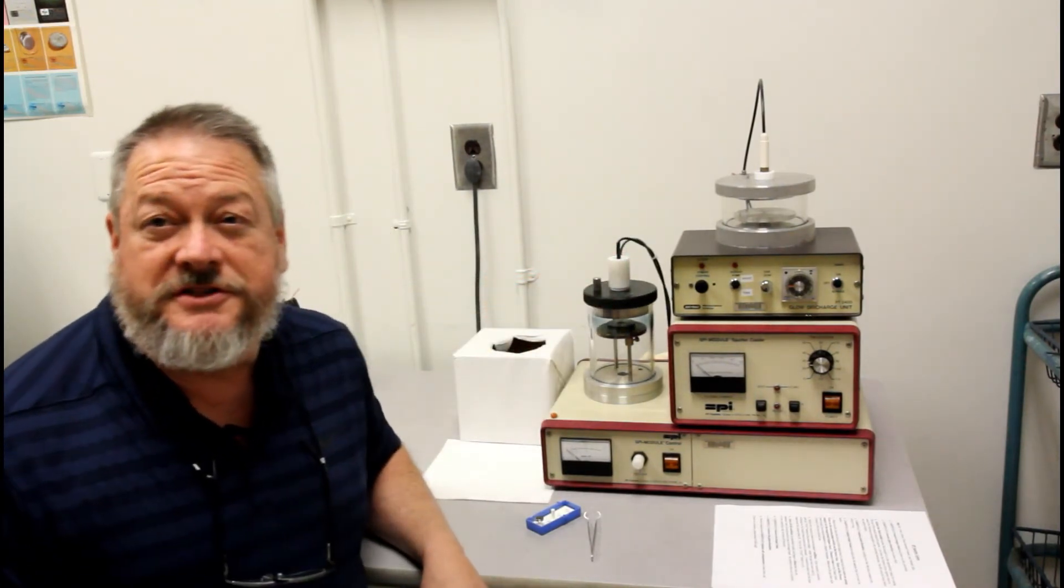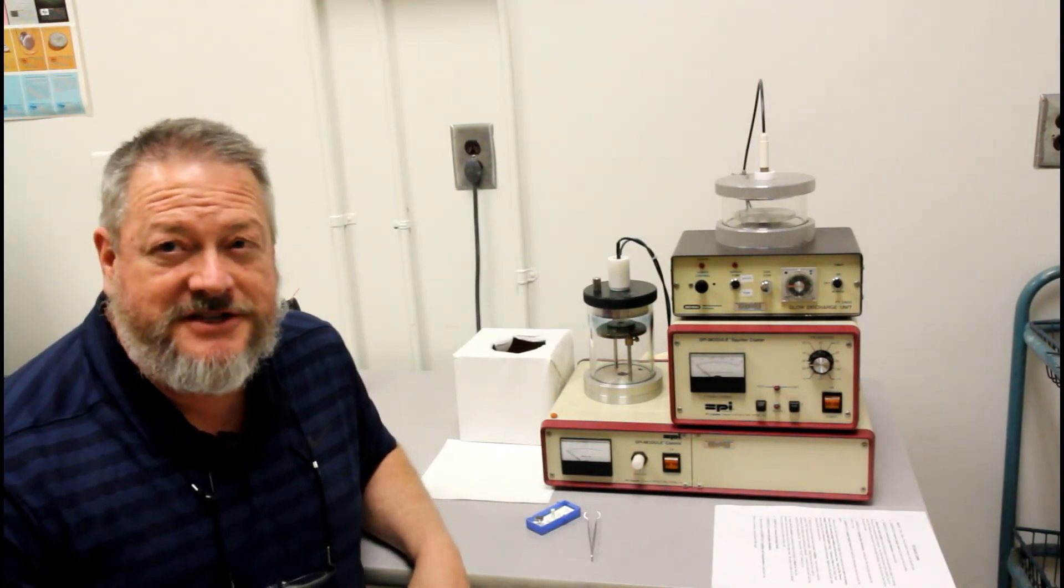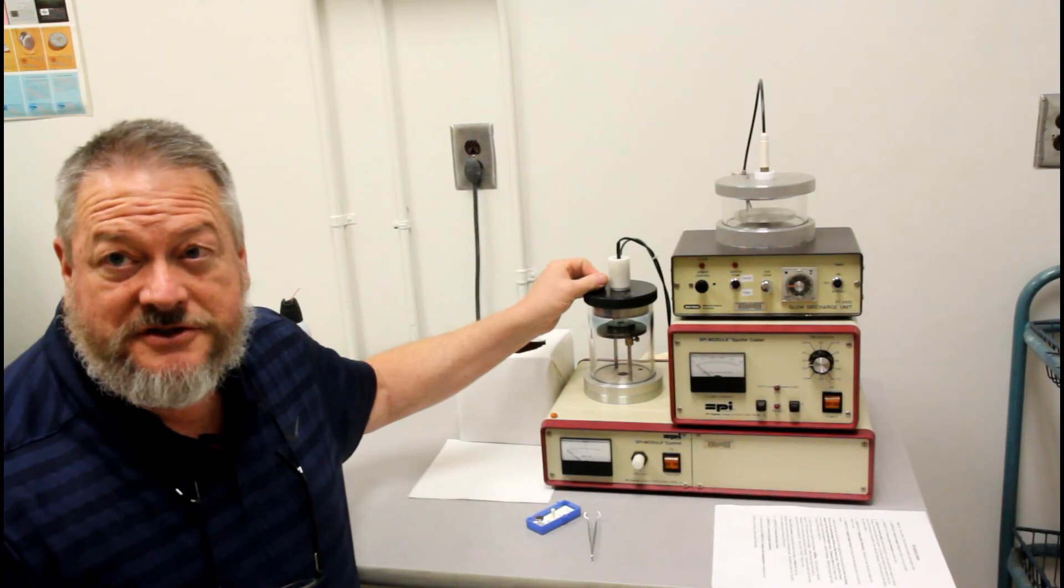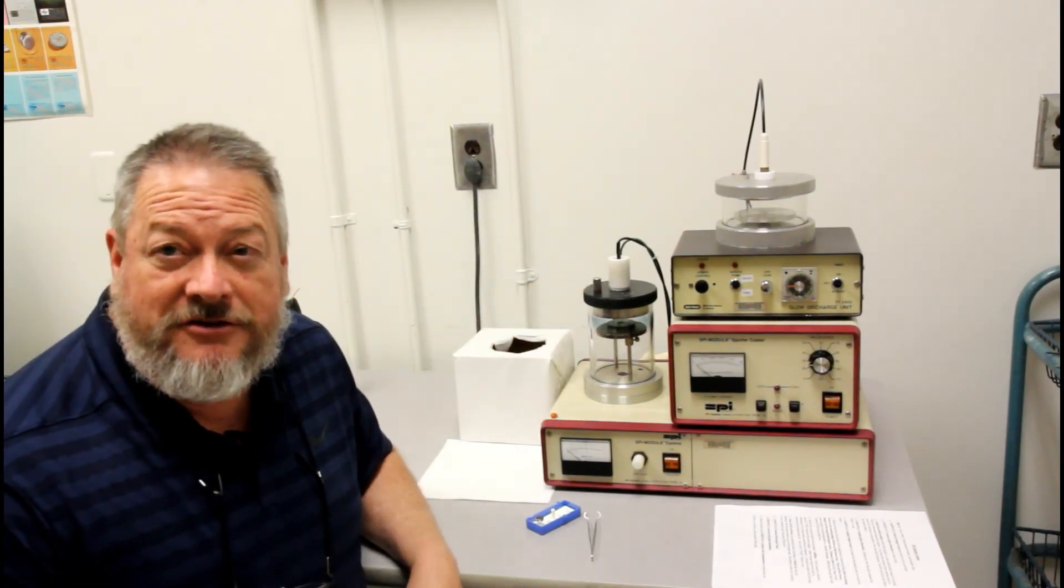Place the whole assembly back together again to keep dust out of the sample area. And then I typically close this valve back up again. And you're all finished.